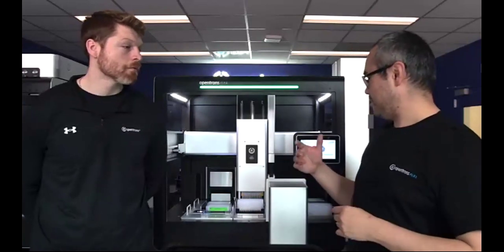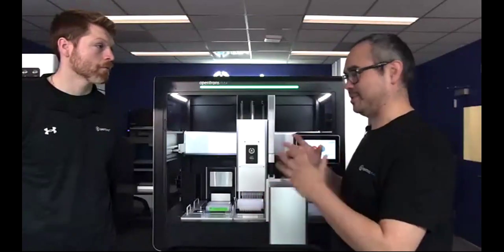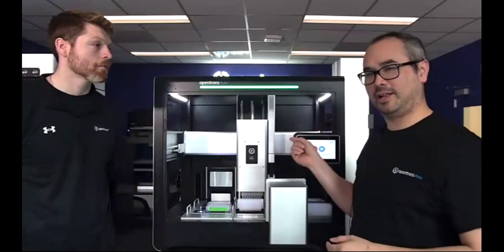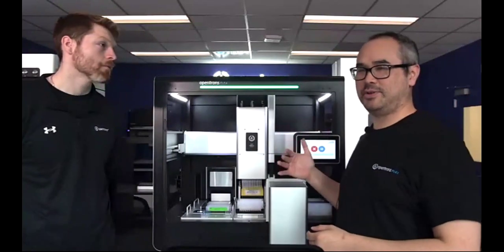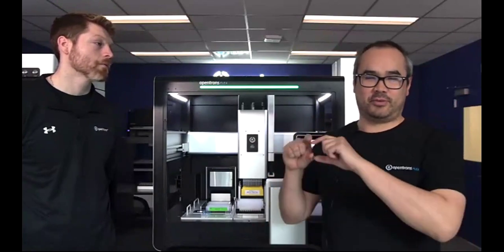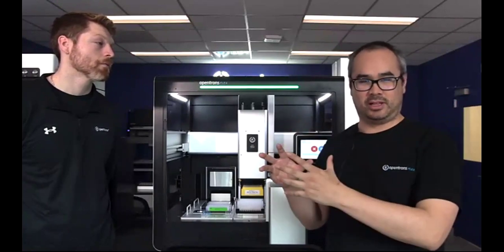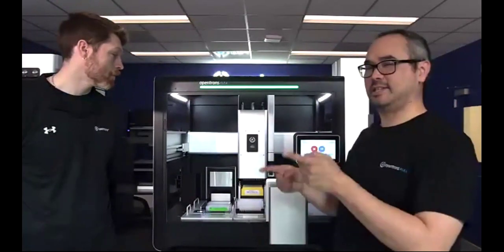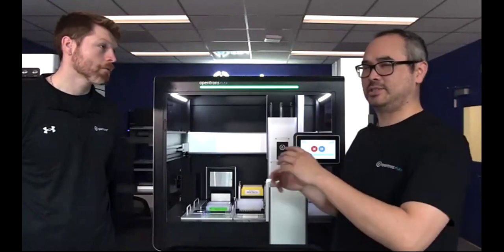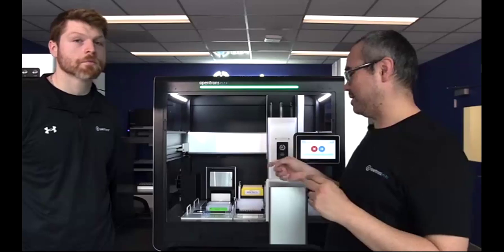Yeah, so in this particular situation, since I have 96 channels operating simultaneously, I didn't want to put reagents into a single column so that I would have to use the single column pickup. Even though it can do that, I wanted to save time with a single reagent pickup. So I have the reagents already dispensed into wells on a 384 deep well plate, where everything is in its correct position. The wells that would be the reagents for A1 are in A1. Everything's positioned already in the deep well plate.